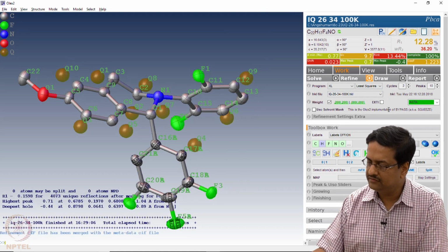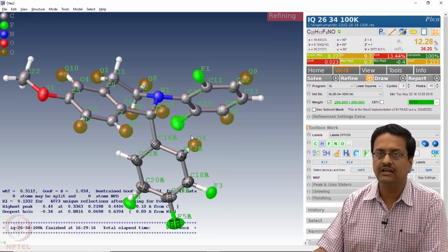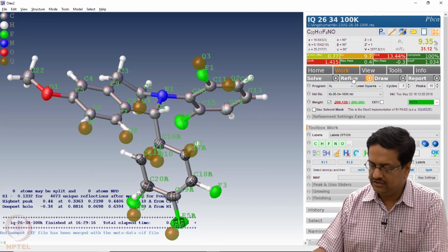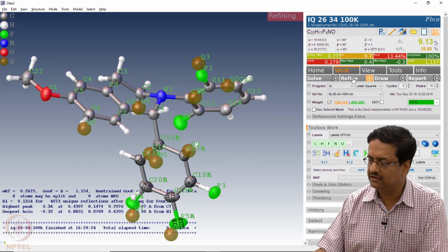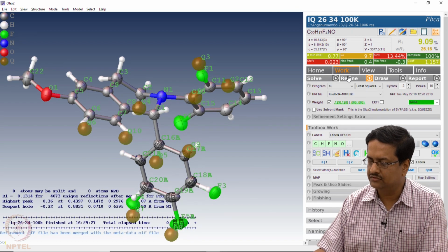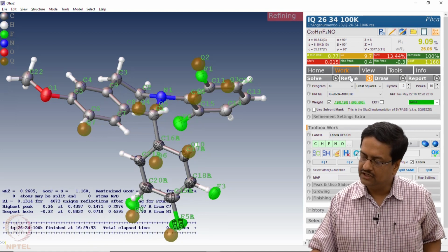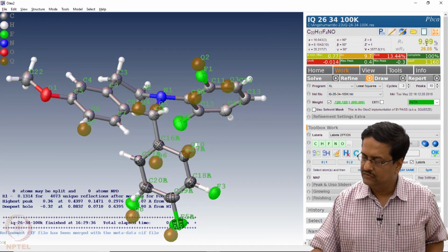If it is not coming, don't worry, we just add hydrogens because that is not done here. Until and unless we add hydrogens, the structure is not complete. So now when we have added hydrogens and we try to refine it a few more cycles, you can see that the shift is coming close to 0 and the R factor has come down to about 9%, which is showing here.